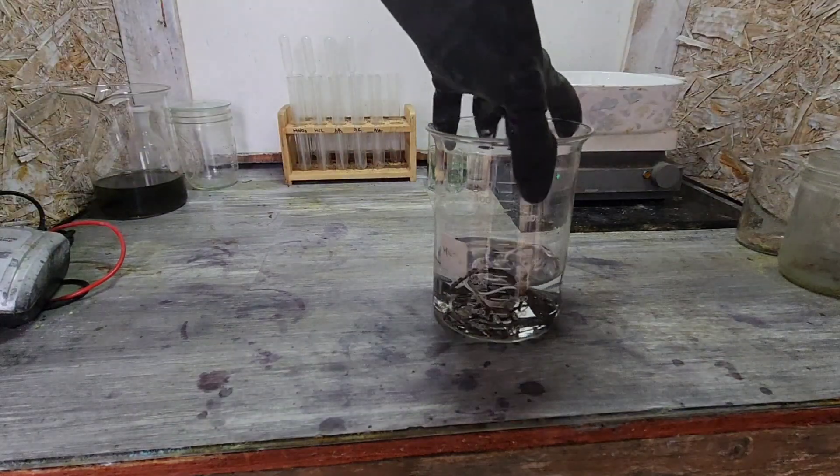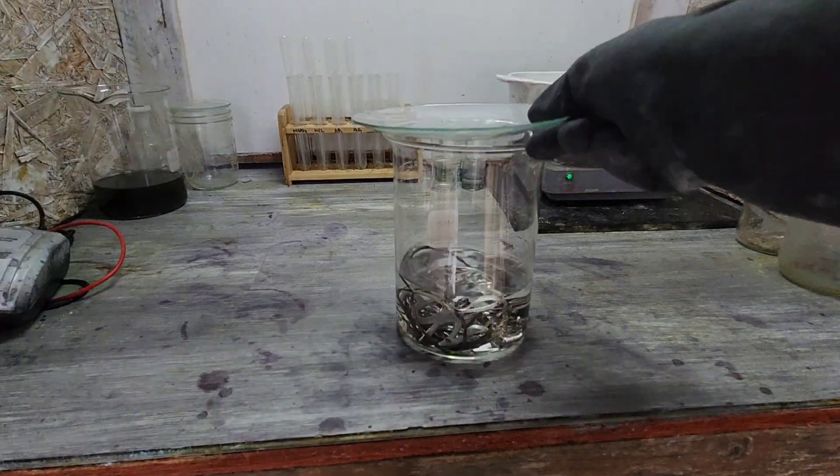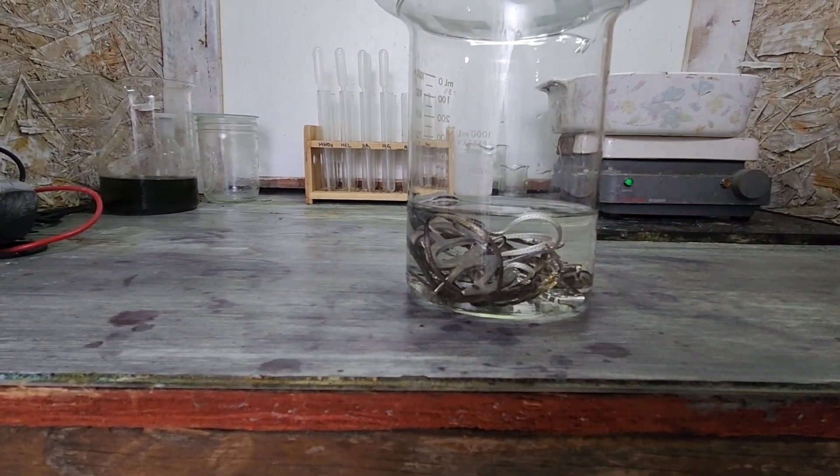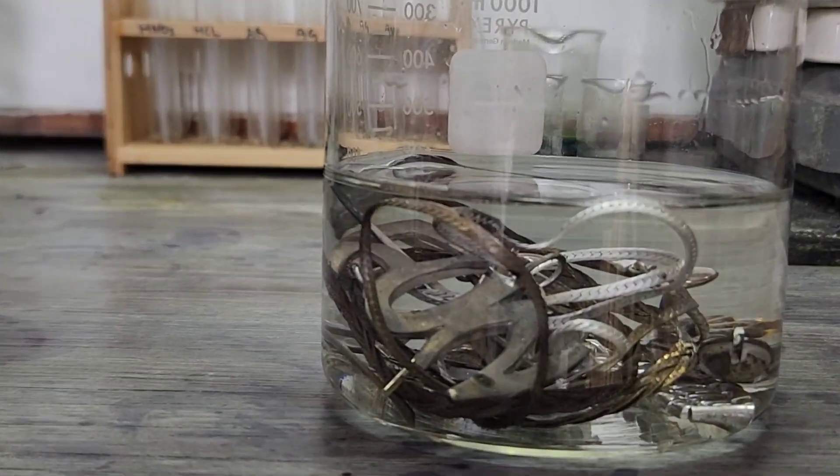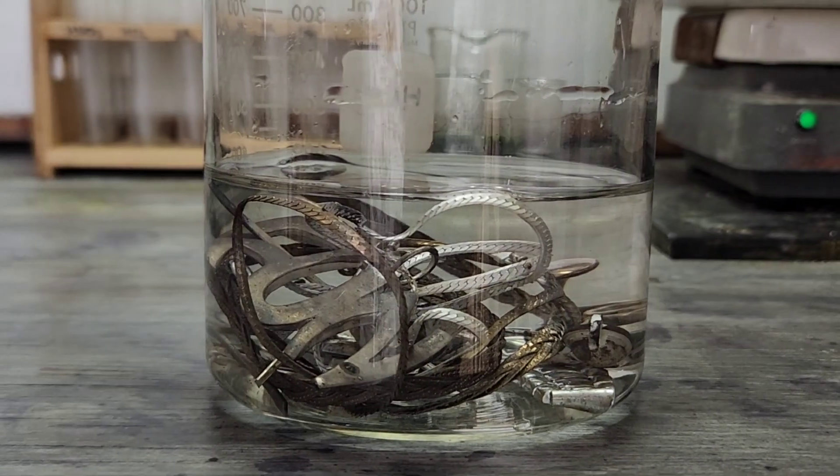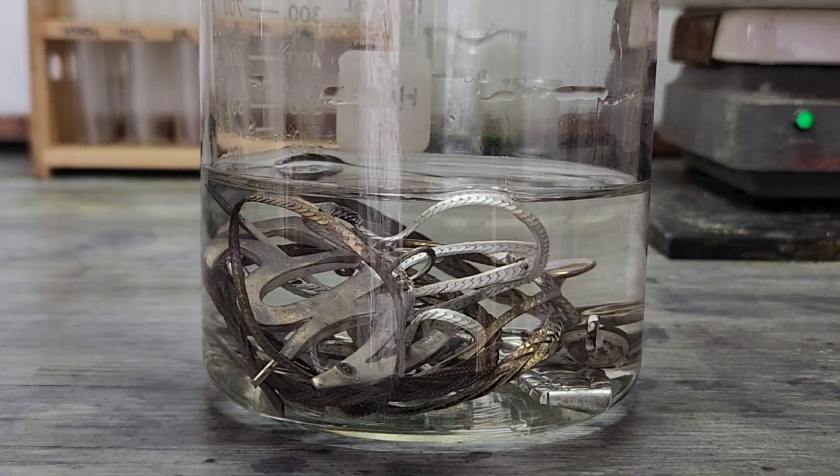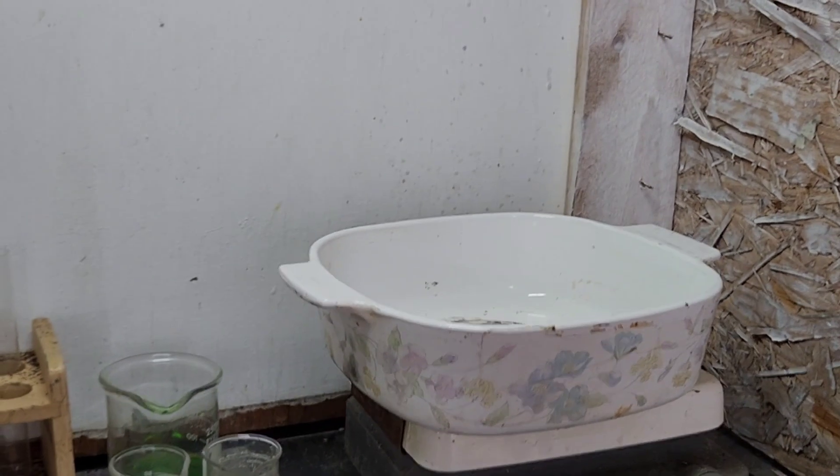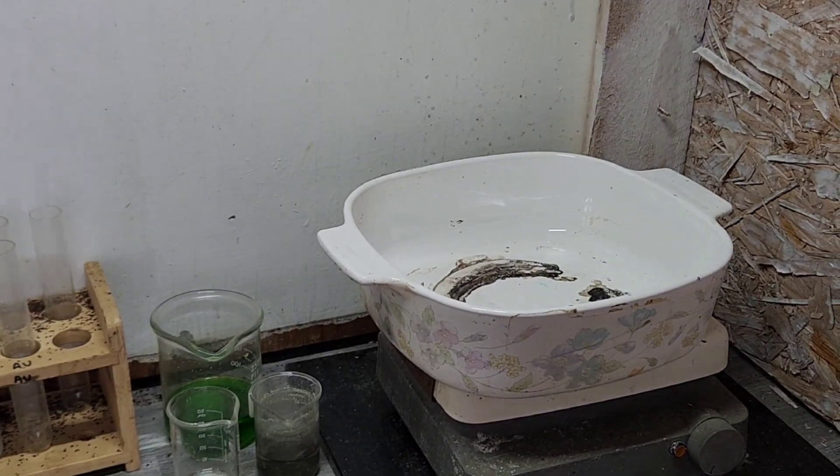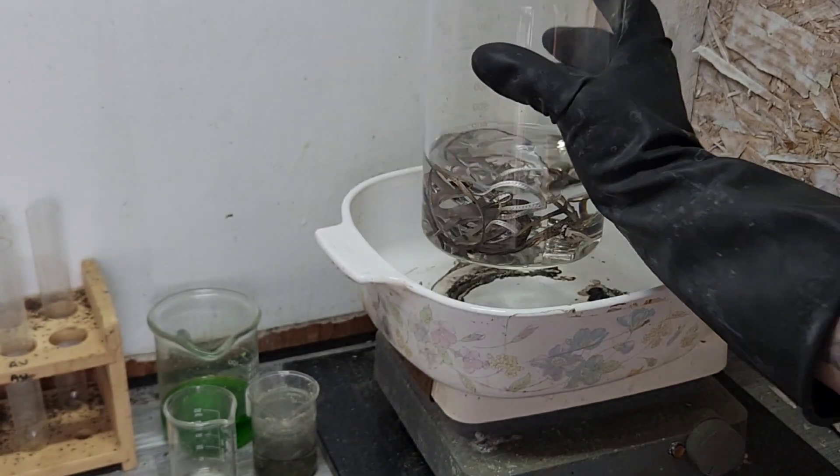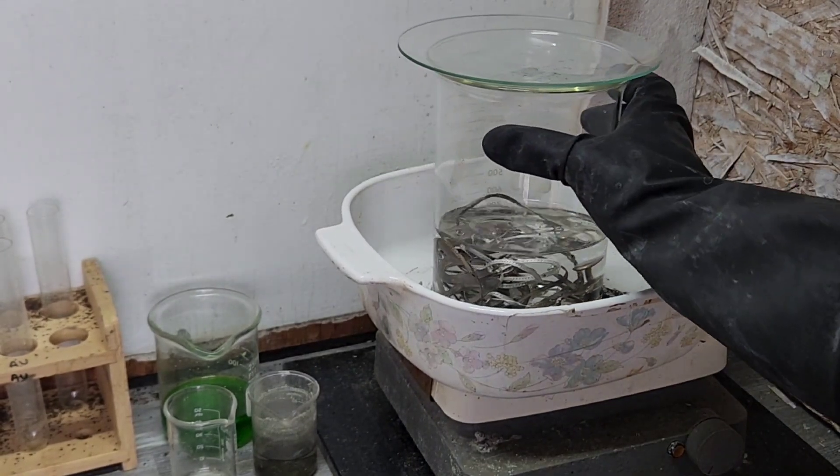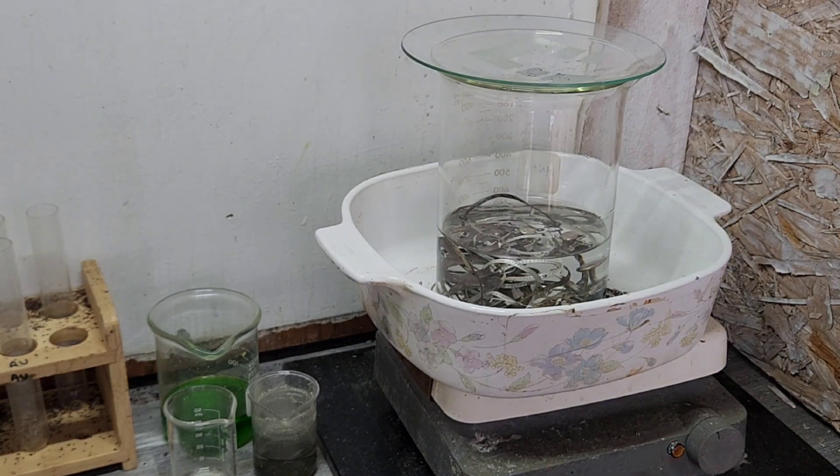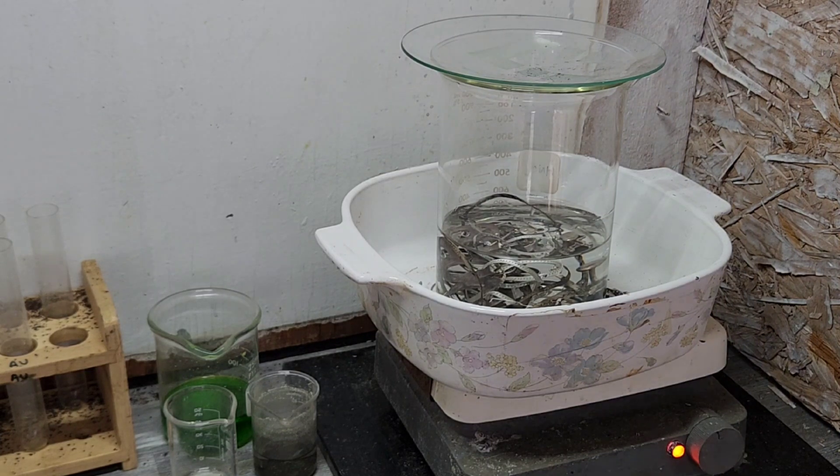We'll put our material in. That's actually not too bad. Not too bad at all. We gotta put this on some heat too, but I don't think we're gonna get an initial reaction. Still a little cold and it's a little dilute, but I know we're gonna have to add some more nitric in here. But we can do that when this reaction is ready to roll.